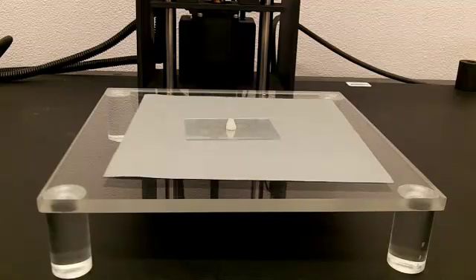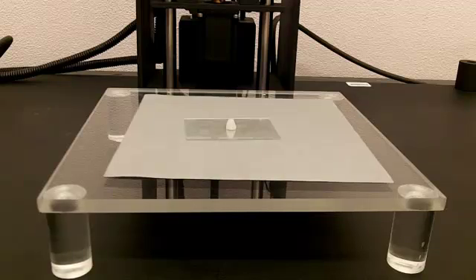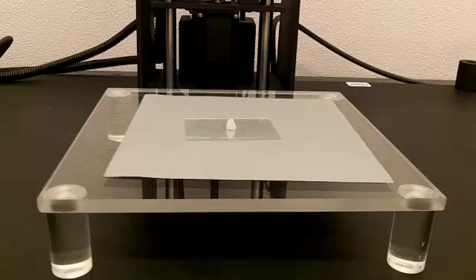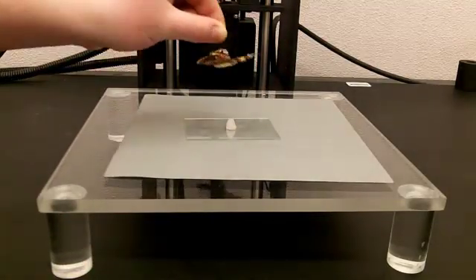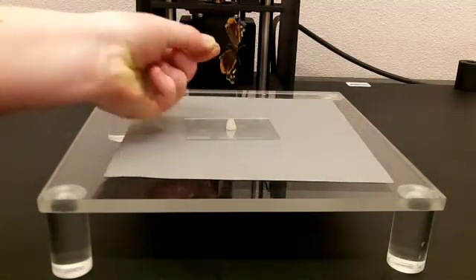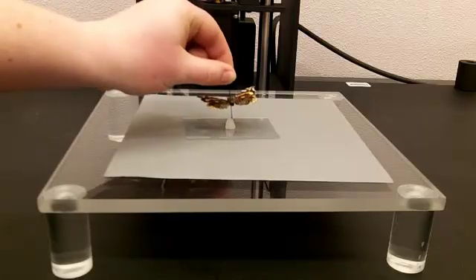Unlike other types of shots, which we use the pointy end of the pin to stick through the stands, for ventral shots on our specimen, we use the top part of the pin and we stick that into the glob of wax.